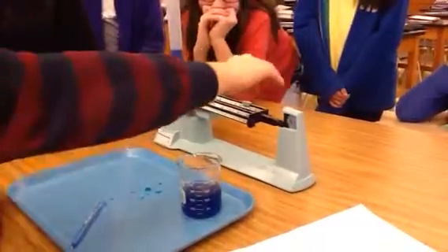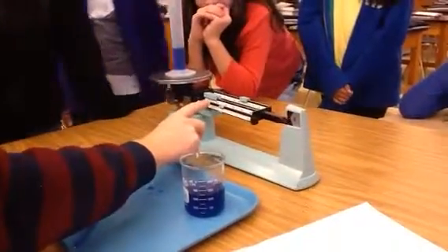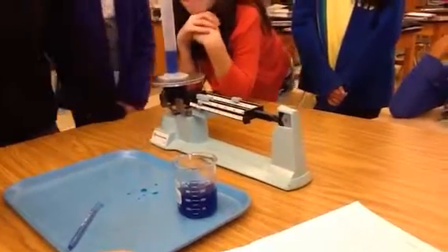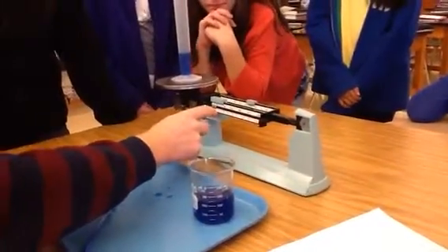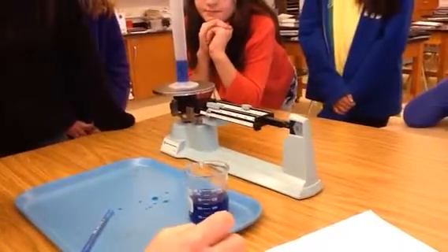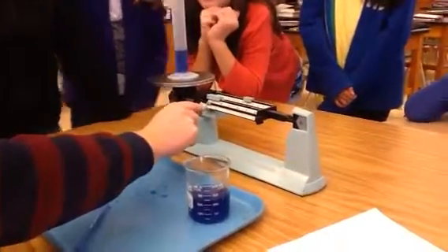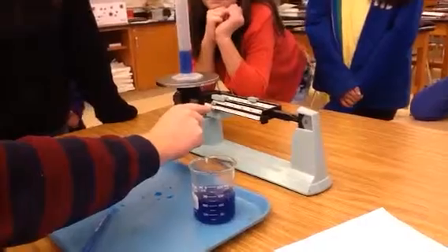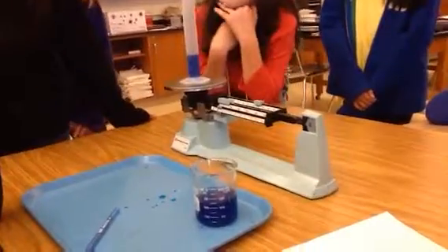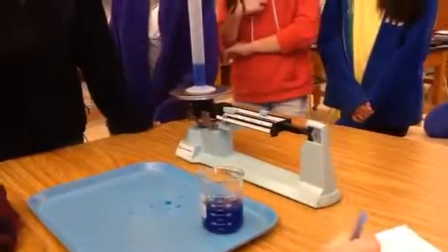Now we're going to put that back on the scale. It goes down, so move it back one. That's too much. Go back a little bit. It should be somewhere around here. More. That looks good, right? So we have 60. We didn't have any hundreds here, right? And now we have 1, and it's between 1.4 and 1.5. If it's between those two numbers, we'll always go to the larger number, so it'll be 1.5. So my answer is 61.5 grams.